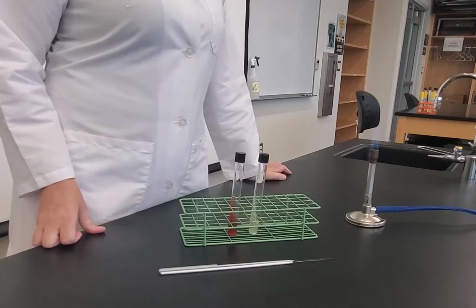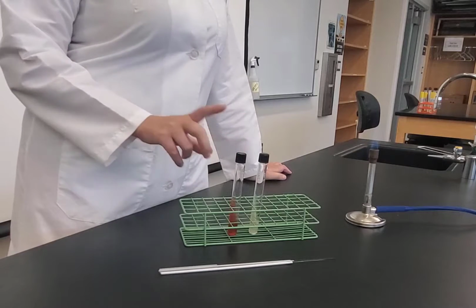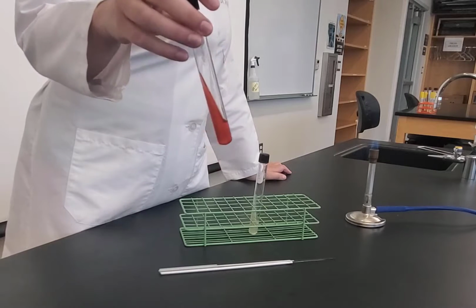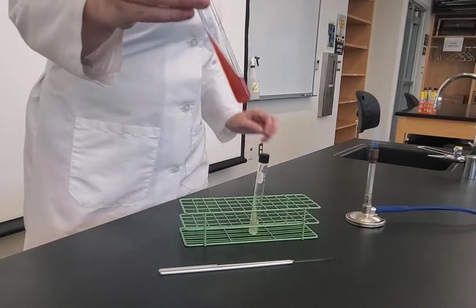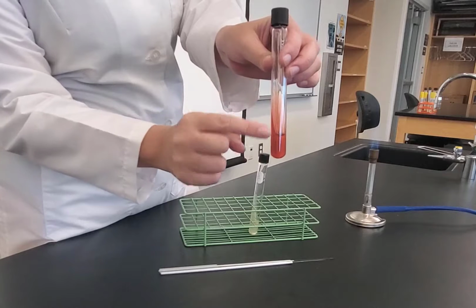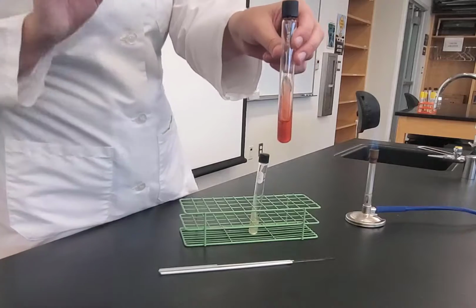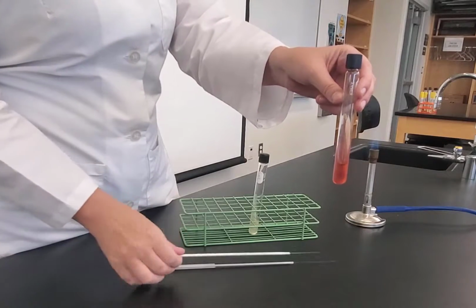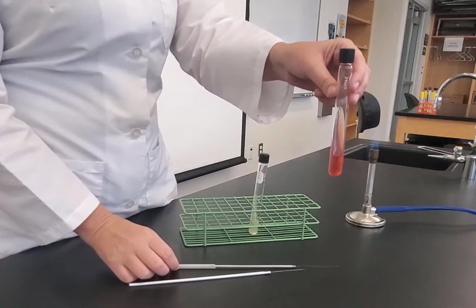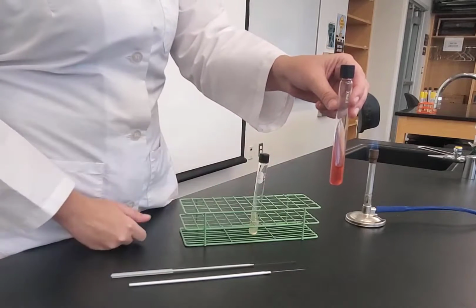So in this experiment, we are looking at the triple sugar iron agar, TSI for short. So this is our TSI test. We have our triple sugar iron agar, and you'll notice that it's a slant, but it also has this region down here that we call the butt. So we have a slant and we have a butt. When we inoculate these, we are going to stab the butt, which basically means we're going to stab inoculate with a needle, just straight down and straight up. And then we will also inoculate with the loop and do a zigzag slant on the slant portion.